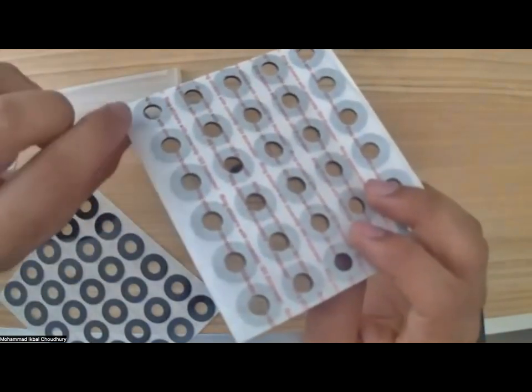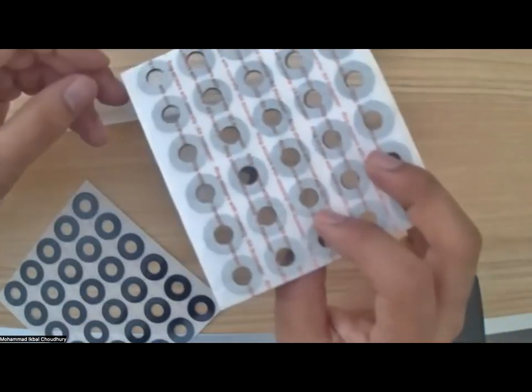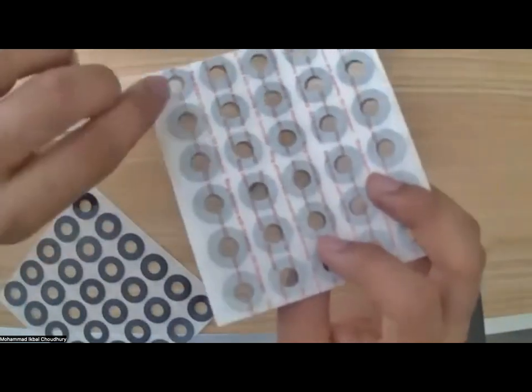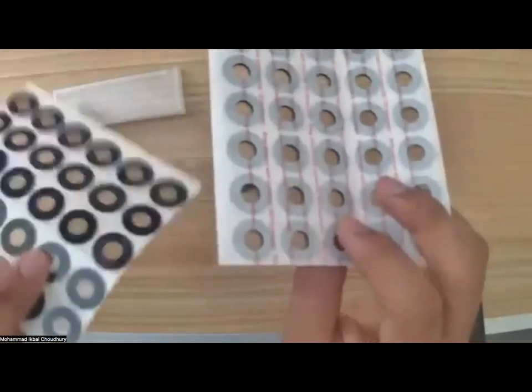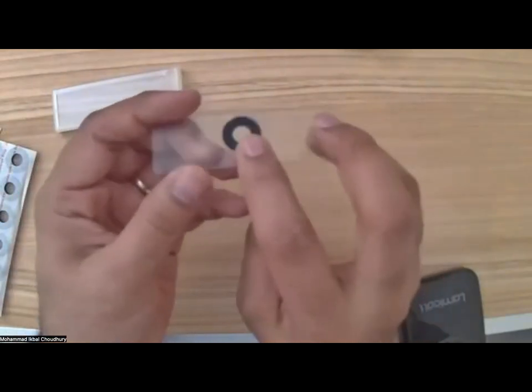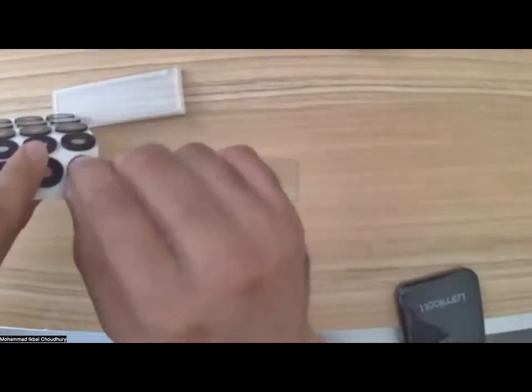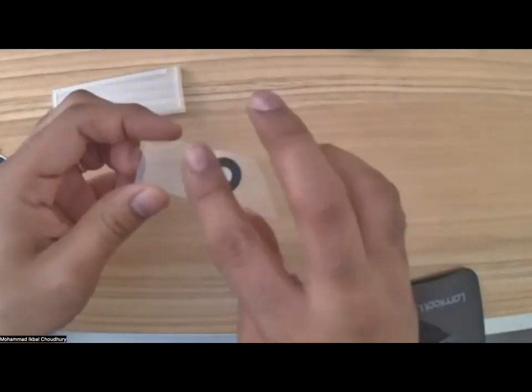The whole reason is if you are dealing with liquid sample, which we will in this program, it's a good idea to not spill the liquid on the microscope or anywhere. You want to hold the liquid sample within a pocket. So the ring sticker enables that. What I did is I took a ring sticker out, a fairly thin one. It doesn't have a lot of thickness, and I placed it. It's very basic, right? You take the sticker out and you place it on the glass slide and just tap it so that it sticks.